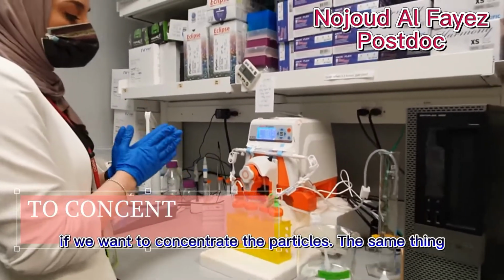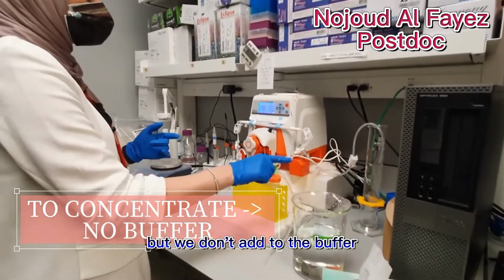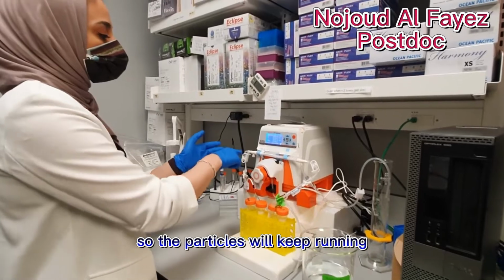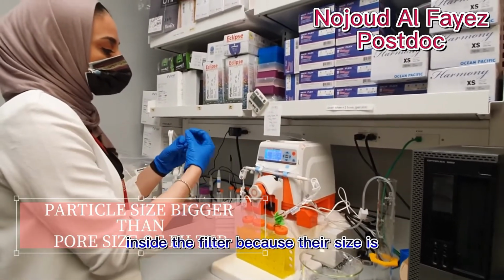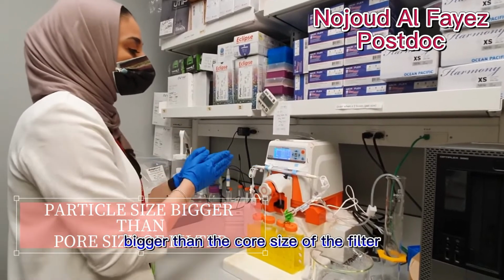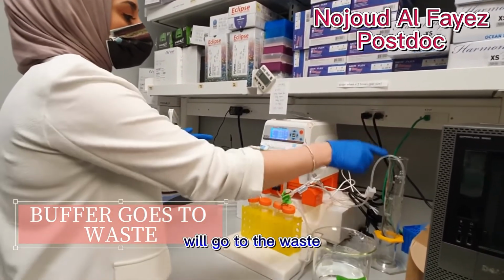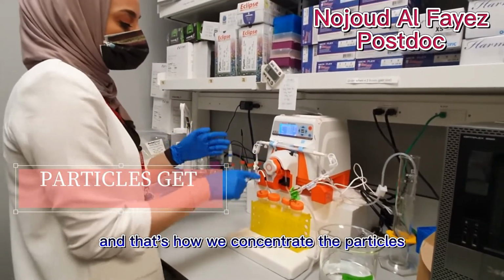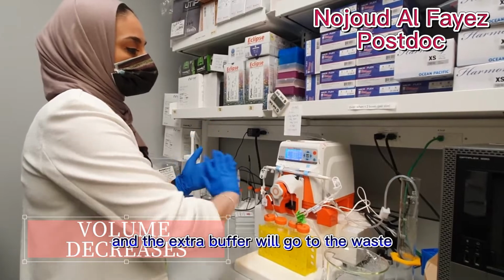If we want to concentrate the particles, same thing, but we don't add the buffer. So the particles will keep running inside the filter because their size is bigger than the pore size of the filter, and the buffer will go to the waste, and that's how we concentrate the particles, so the volume will get smaller, and the extra buffer will go to the waste.